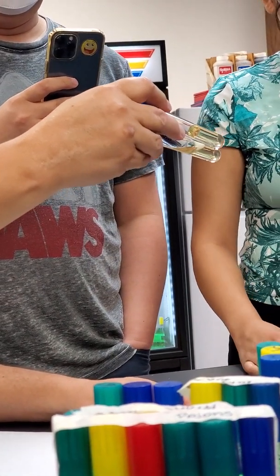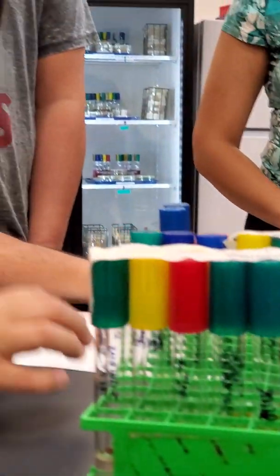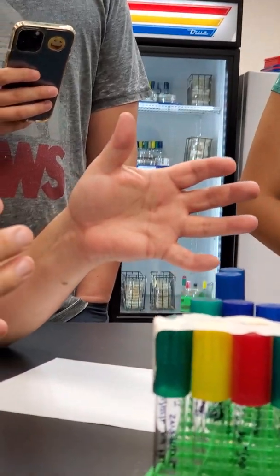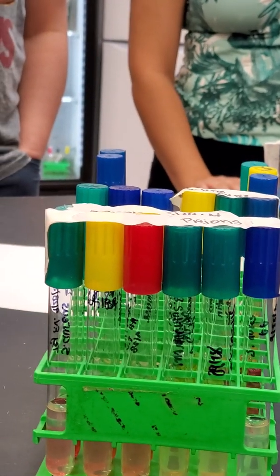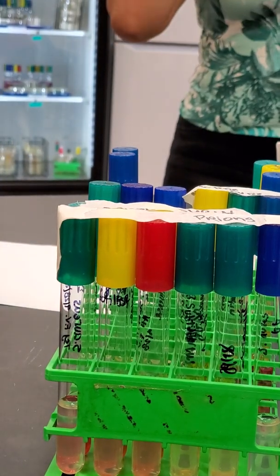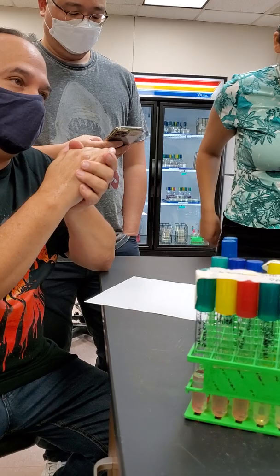Everybody got it? Okay, so I want you guys to spend about 5 minutes collecting data, talking about the test. You can even spend 10 minutes, and then we'll do the new stuff. The new stuff is going to take me longer to talk about than it is for you guys to inoculate, and then we'll call it a day.